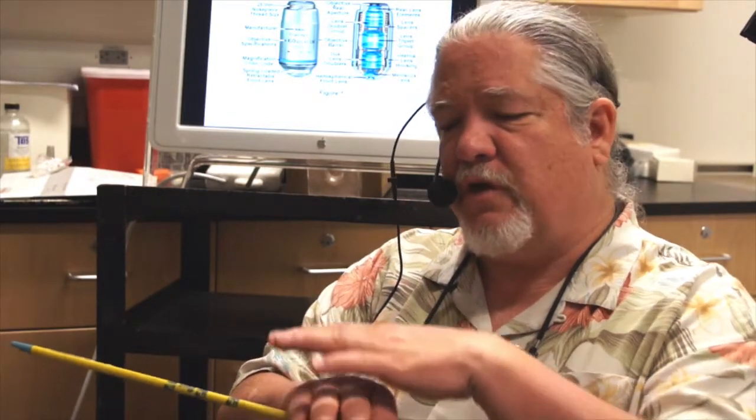What's important is not so much the thickness of your specimen, because a confocal microscope can accommodate a fairly thick specimen, but the mounting medium that you use to glue that cover slip in place is also very important because of a thing called refractive index, and we'll talk about that also.